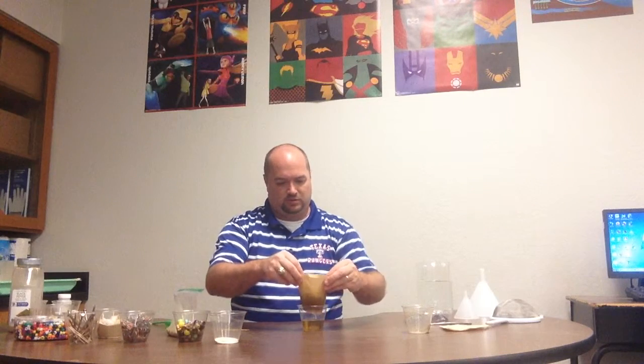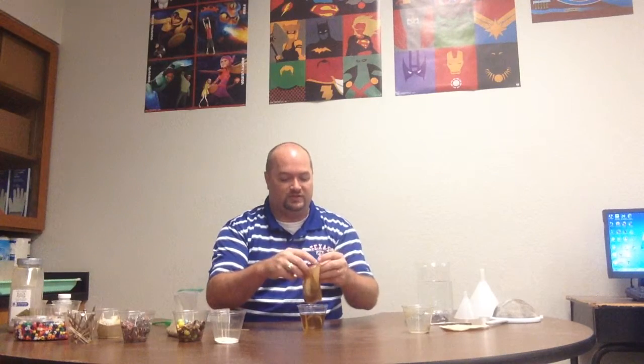That's going to be a little bit of gross residue at the bottom there, but I know it's all pepper, so that's all good. And then I'm going to pull this up to strain out. Now, as you can see, this salt water has got some coloring in it because some of what was in the pepper did dissolve in the water. So pepper, for the most part, is not soluble in water, but a little bit of it is. But for our purposes today, this is just fine.